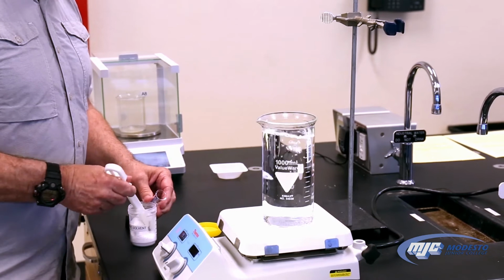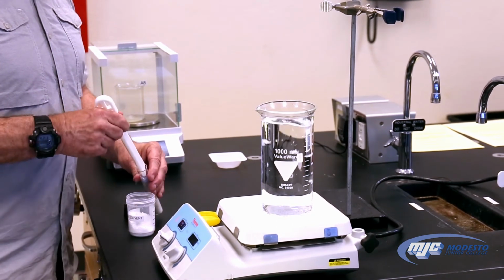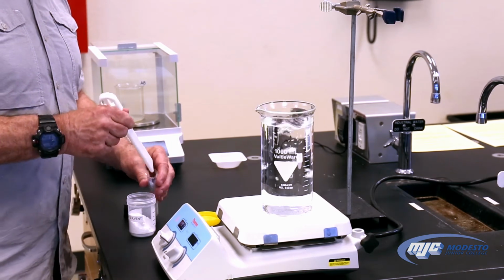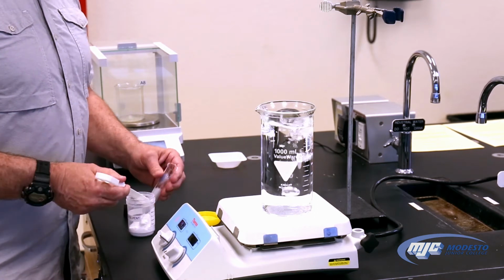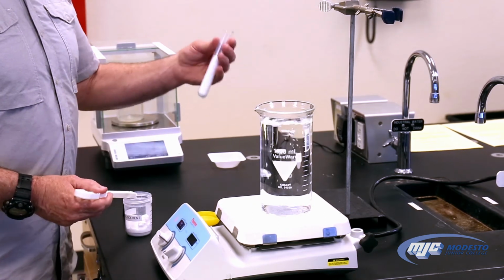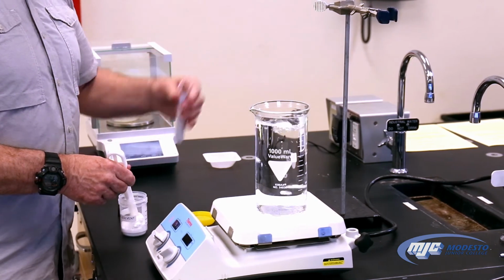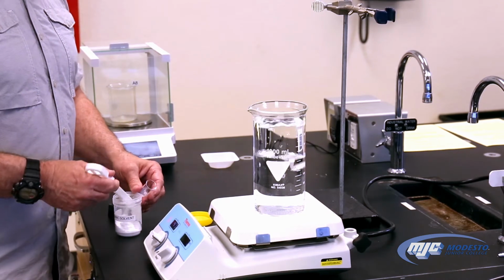We're going to see how much it weighs. However much it weighs when we get it filled up, with just a little space at the top to put the rubber stopper in, that's how much it's going to be. The reason we want to make sure that it's as full as we can get it is that when this stuff melts, it actually shrinks, it condenses, and the level goes down, and we need to make sure that we have our thermometer all the way down inside of it because we're going to measure its temperature.